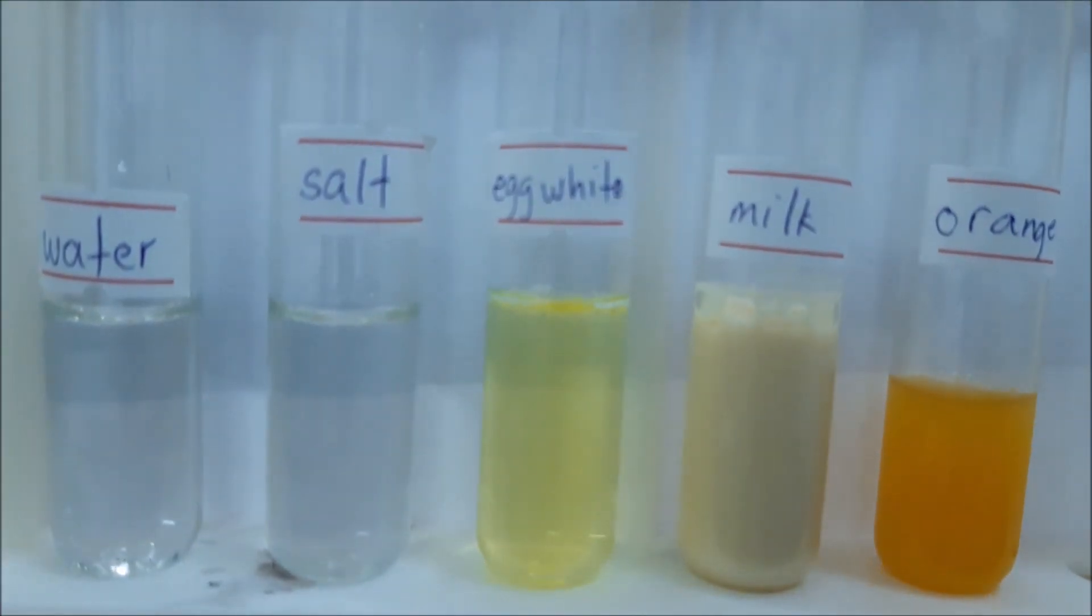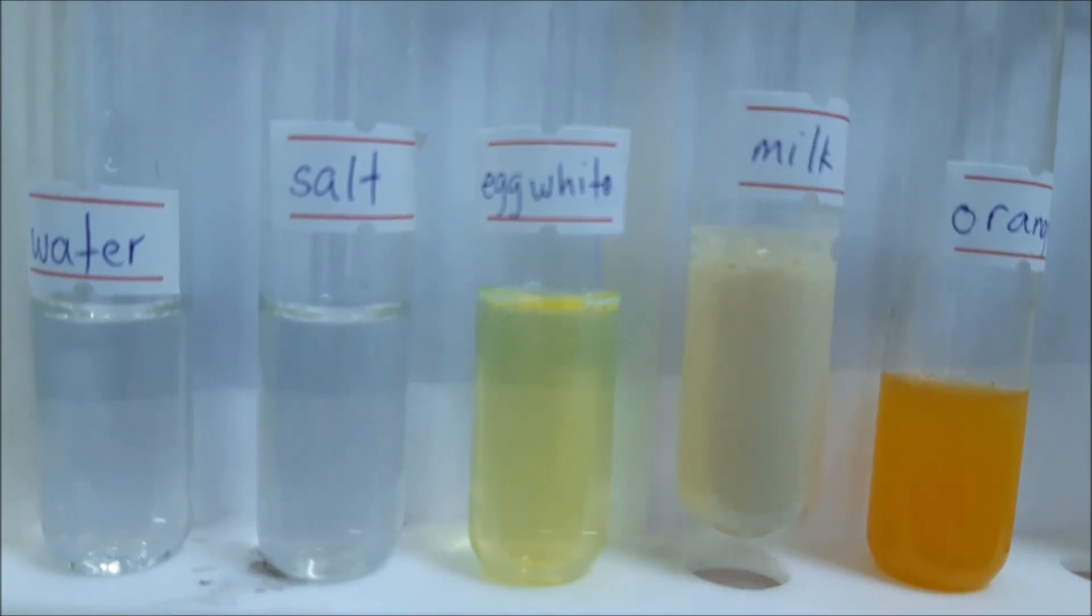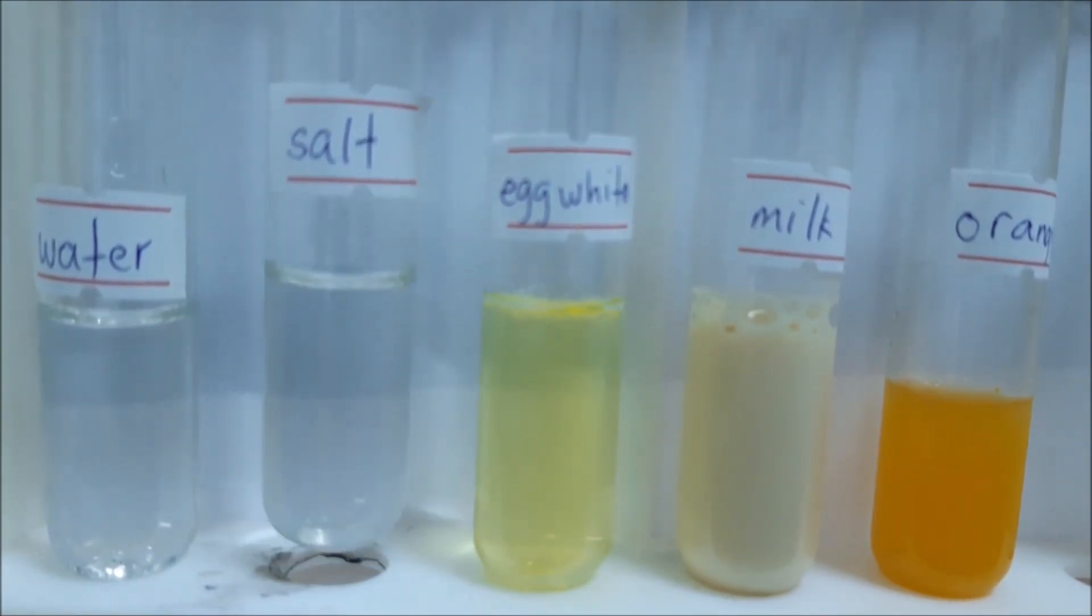These are the food items that we are going to test. We have orange, milk, egg white, salt, and water.